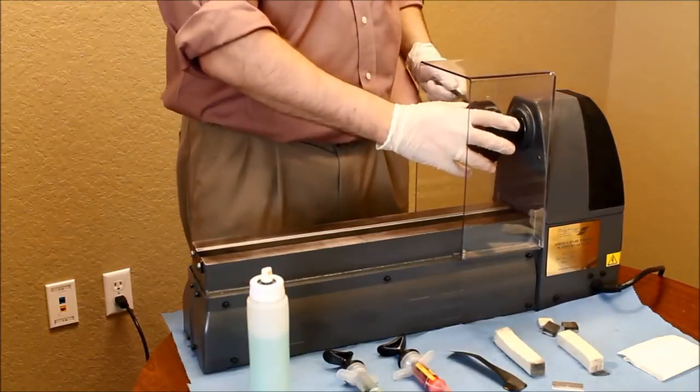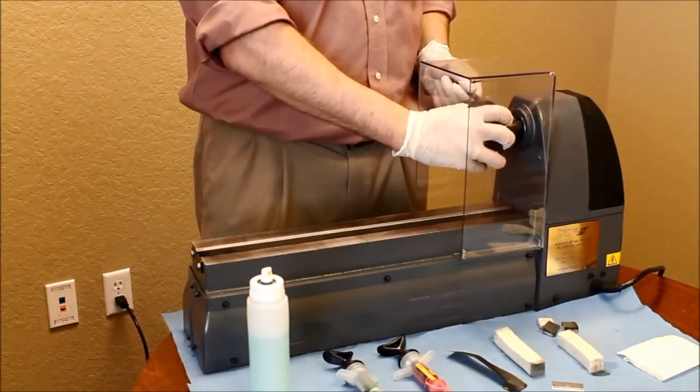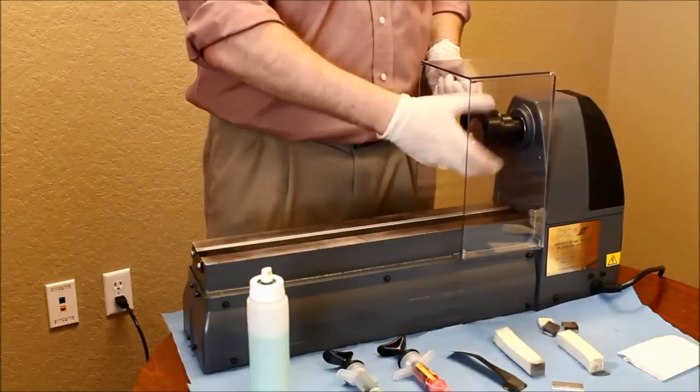Once satisfied with the polishing process, remove the labware from the lathe and jig and wipe away any residual compound.